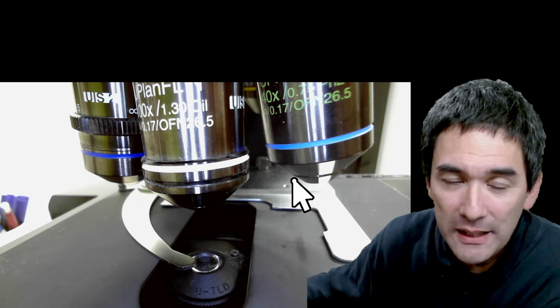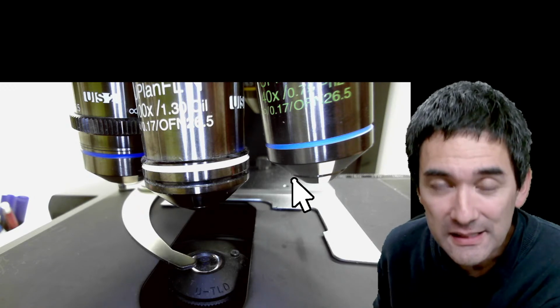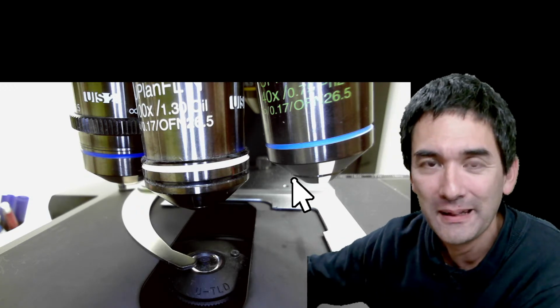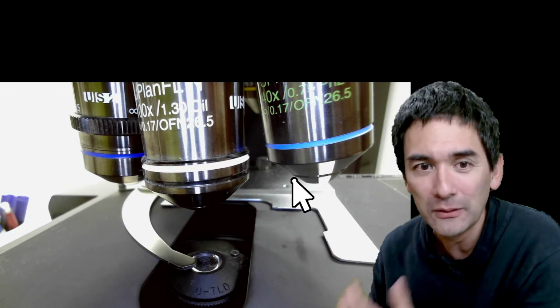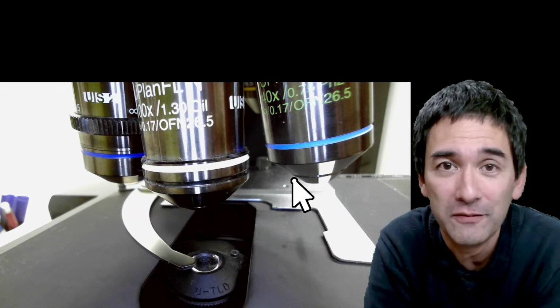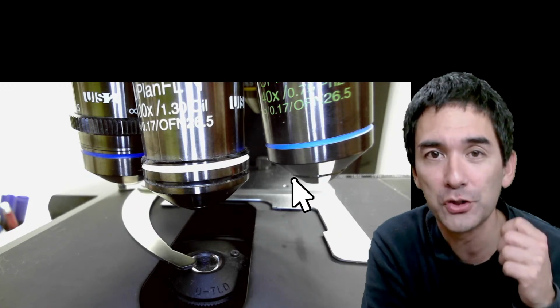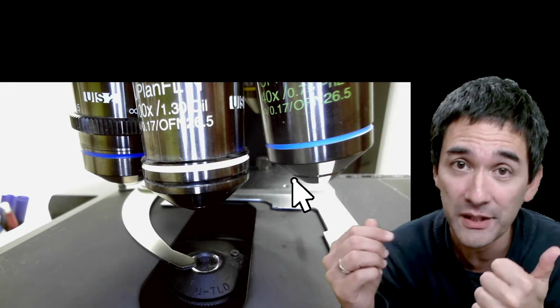These days, if you get yourself a good microscope with modern LEDs, then LEDs have certain advantages over halogen. However, there are some cases where halogen has an advantage. I will simply outline it, because I know it's maybe a topic for a different video, but I still want to answer those questions. Halogen has the following disadvantages. First of all, it creates a lot of heat, so that means the sample evaporates faster.